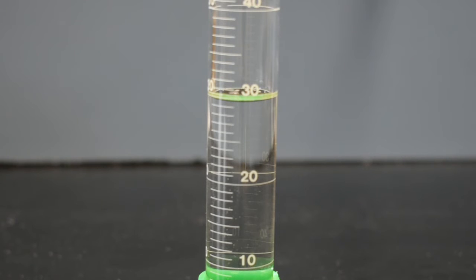Since the volume of the shot is irregular, I can't really use a geometry formula to get its volume. So one way of doing that is volume by displacement. In this case, we have some water. We record its initial volume here. It looks to be just under 30 milliliters. We'll call that 29.7 milliliters. Then what we do is add the shot to the water and measure how much the volume increases. The change in the volume is the volume of the shot.